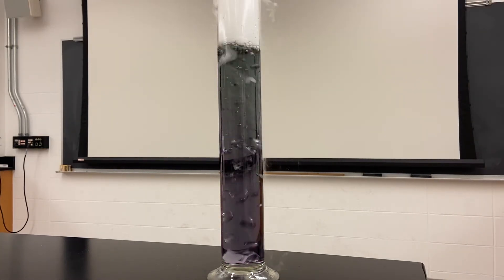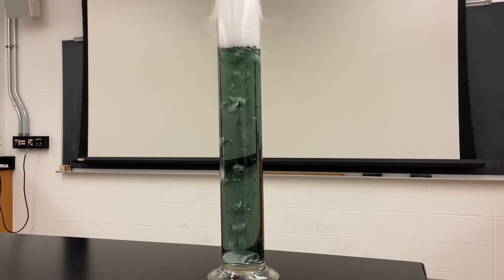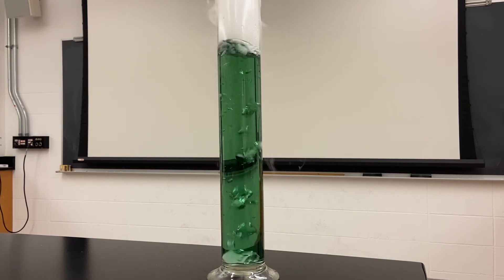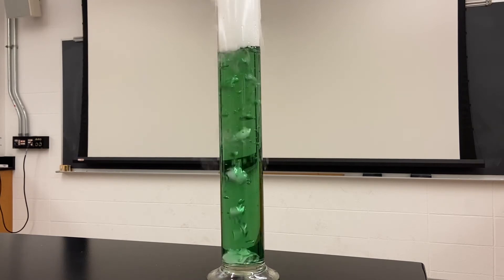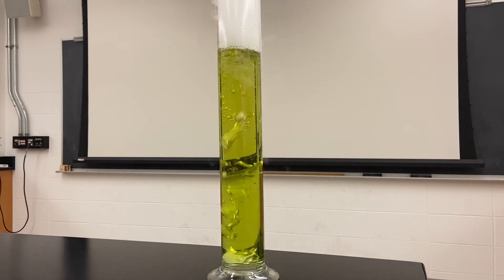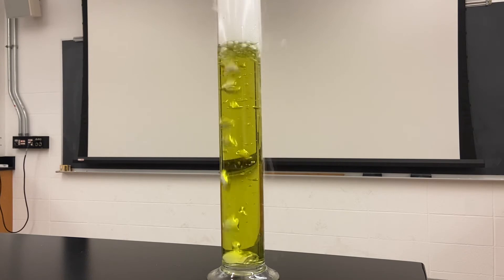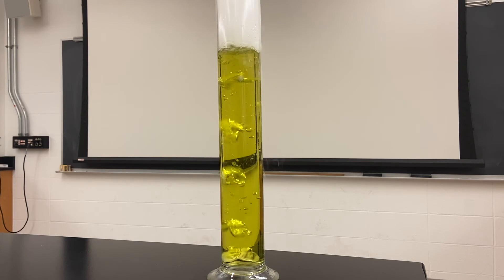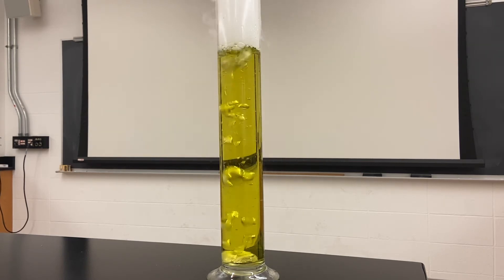You can see it's gone from purple to blue to green — so it's about neutral right now. It's starting to turn a little bit yellow. Now it's very yellow, and as more acid continues to dissolve in it, it's going to approach a red color.